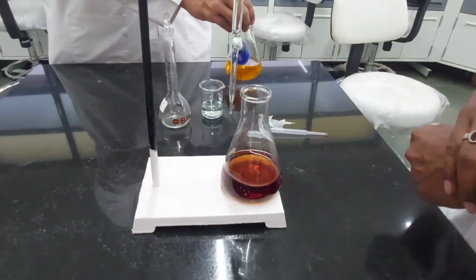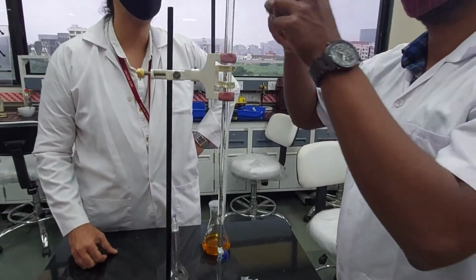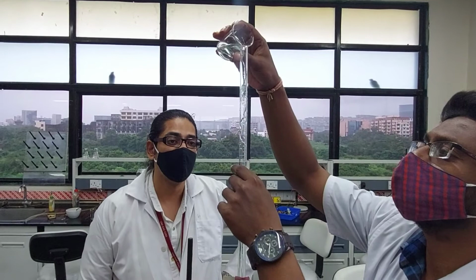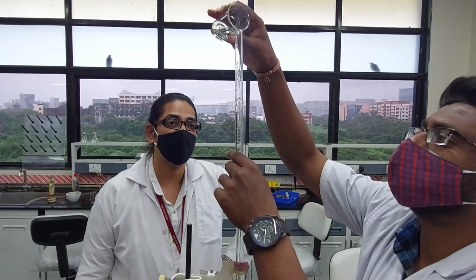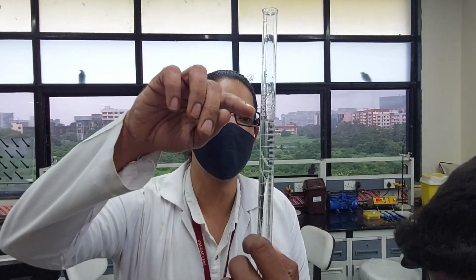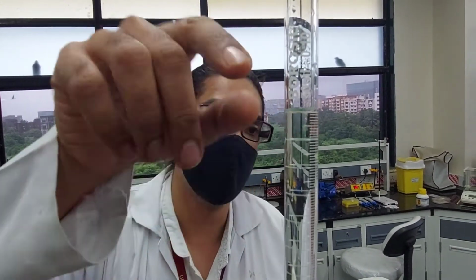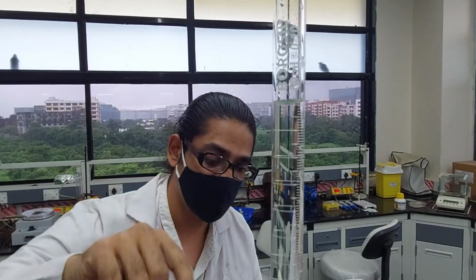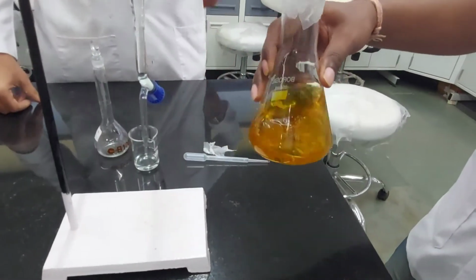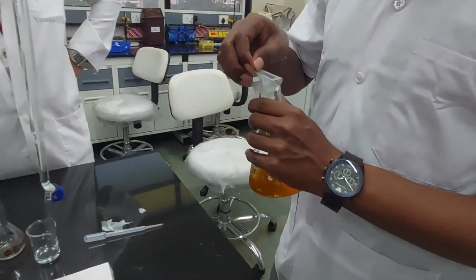Now, likewise, can you refill your burette? Yeah, you can refill the burette. Yeah, there you go. And you have to come to the level to see if it is nice. The lower meniscus nicely matches the upper mark of 50 ml. Right. Now that's the sand soil sample we have got, and likewise we'll be titrating all the other sand samples.